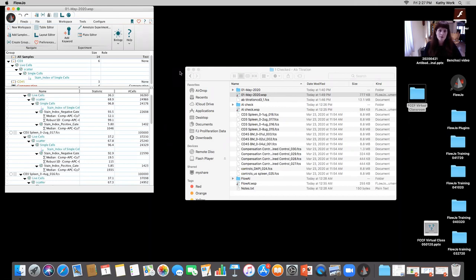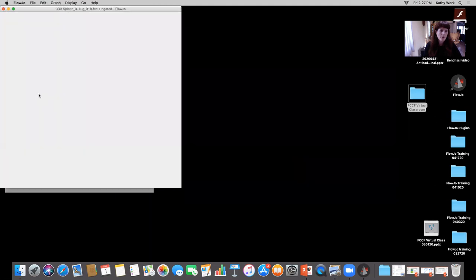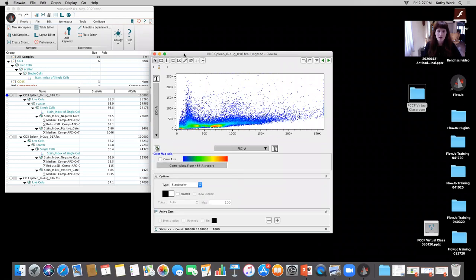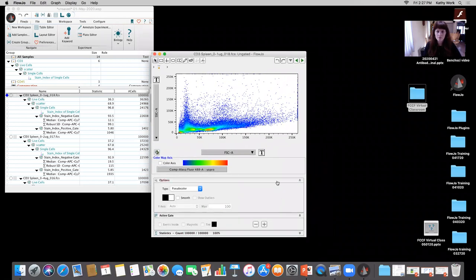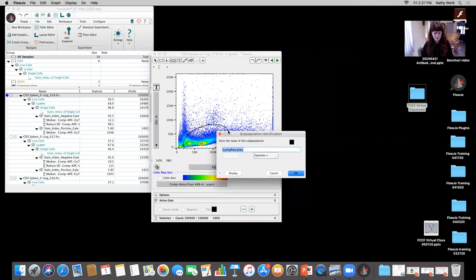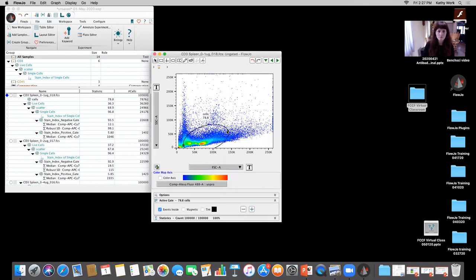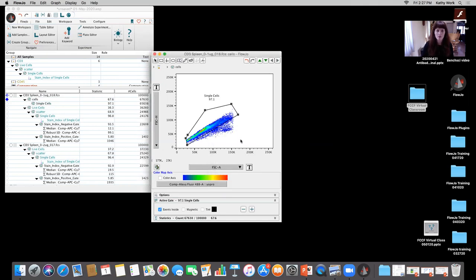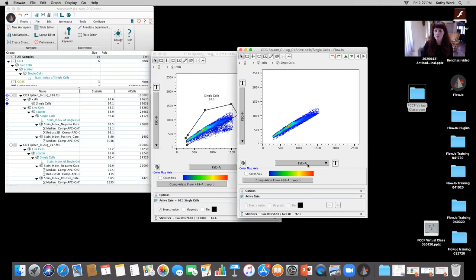Okay, so this is that titration example that I brought up earlier. If I open up the CD3 and look at forward scatter and side scatter and adjust this a little bit, make it a little bit easier for everyone to see, I make the assumption that these are my cells of interest right there. Okay. So if I make a gate right there, why does it matter whether or not I have a viability dye? Double click in there, look at forward scatter height versus area for singlets. Do a quick little gate. Single cells. And then I'm going to look at CD3.